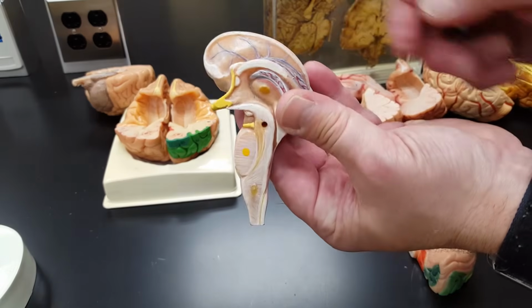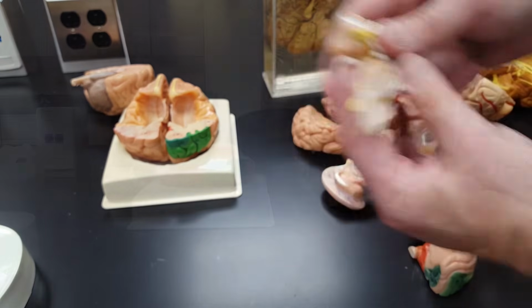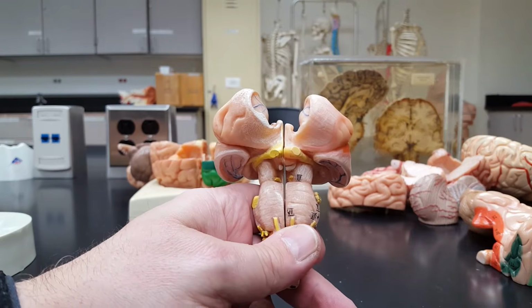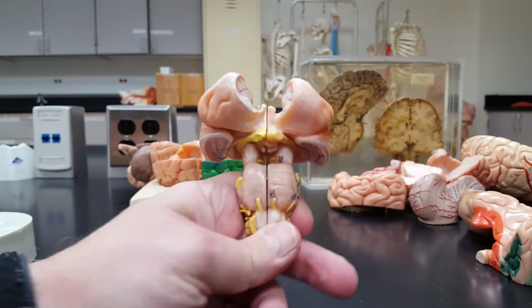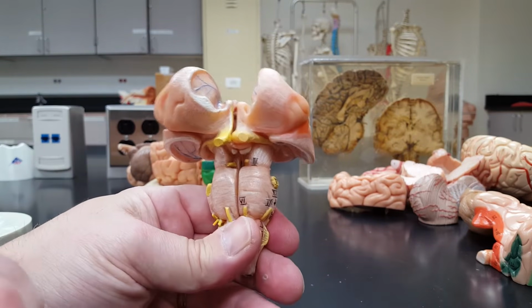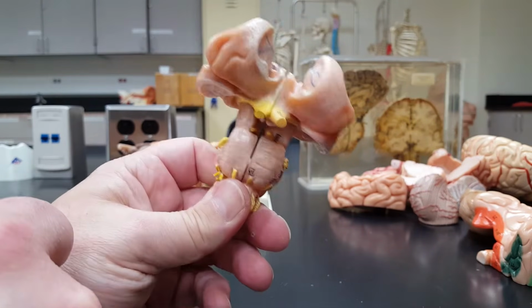If we look at it again in sagittal section, I can see medulla, pons, midbrain right there. Now you people have been in A&P long enough to know we love some goofy terms. So there's a structure associated with the pons that you must also know the name of, which could probably be seen best in this isolated, mostly brainstem.